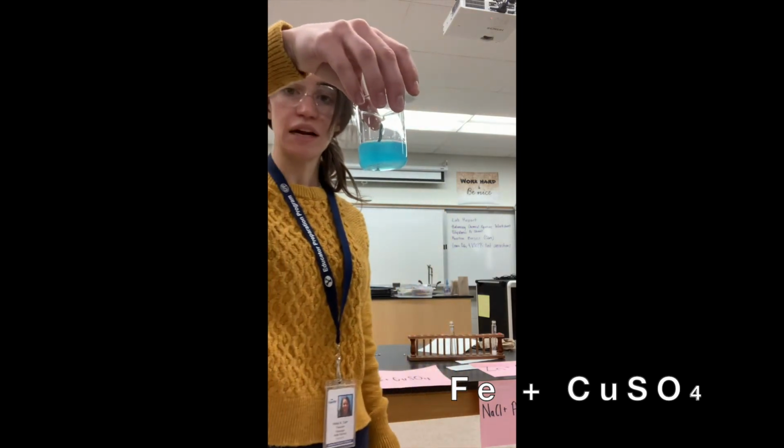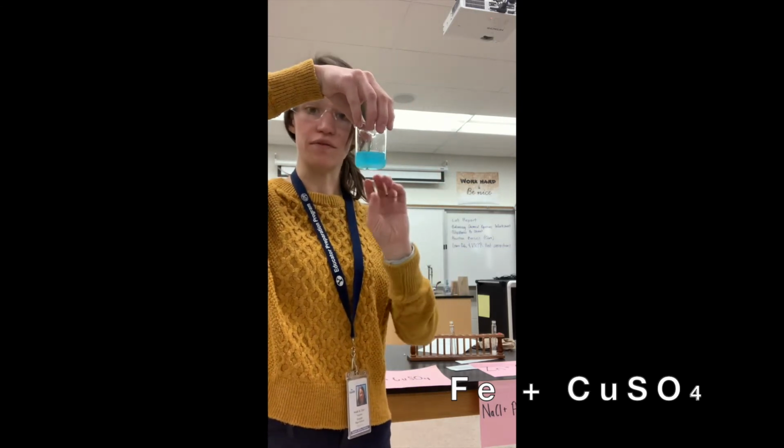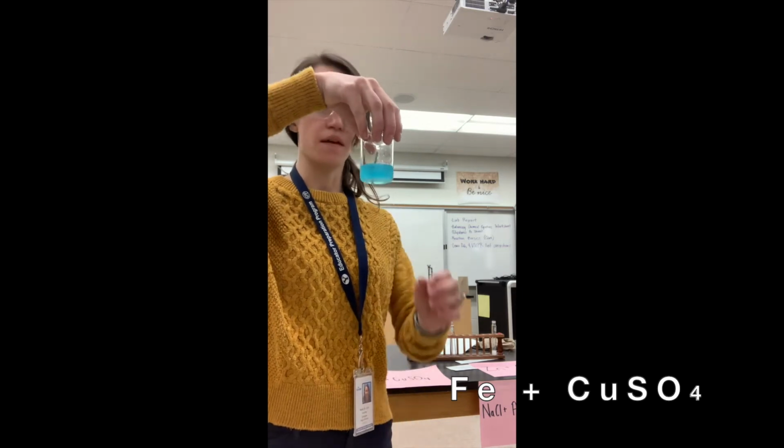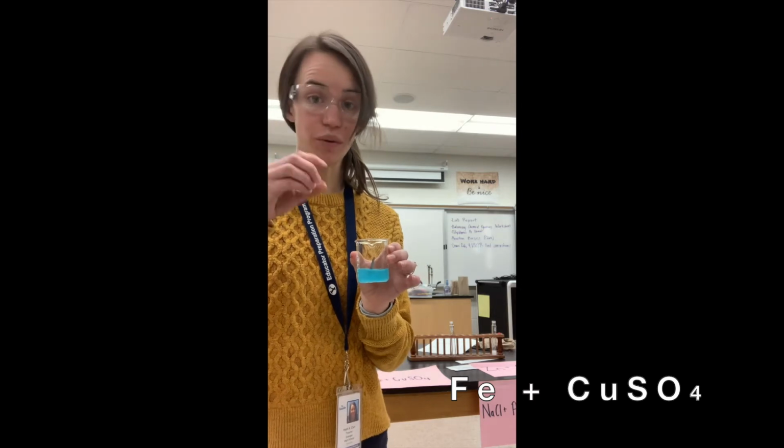All right, so it's in there. We're gonna see a chemical reaction happen. We're gonna be able to visually see it by looking at the nail and the liquid. And it looks like we're already gonna be able to start seeing that. So I'm gonna pull out the nail and I'm gonna show you what it looks like now.